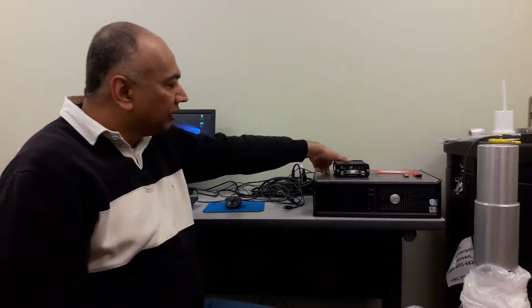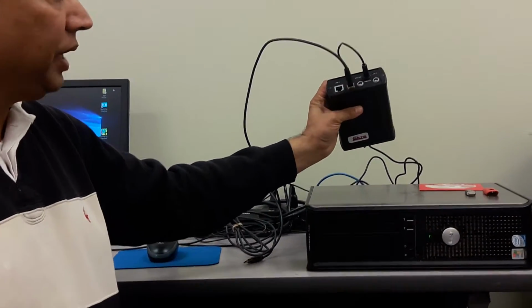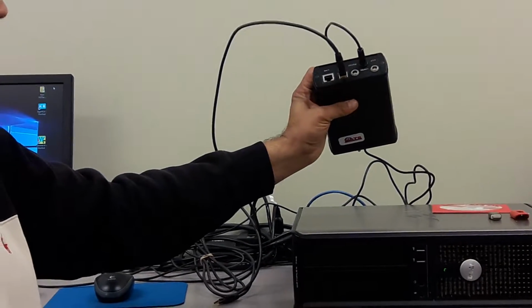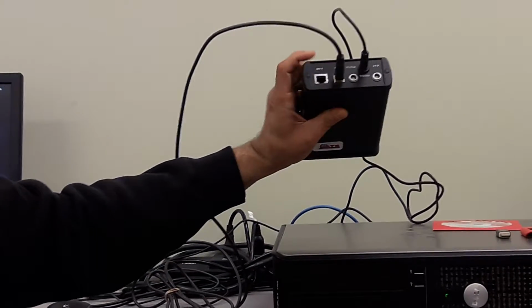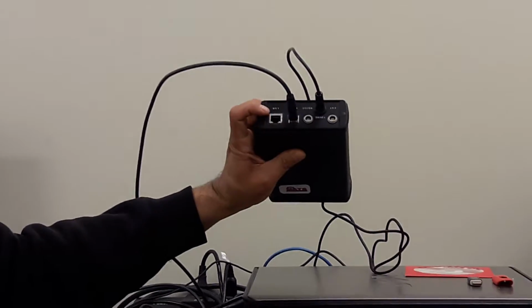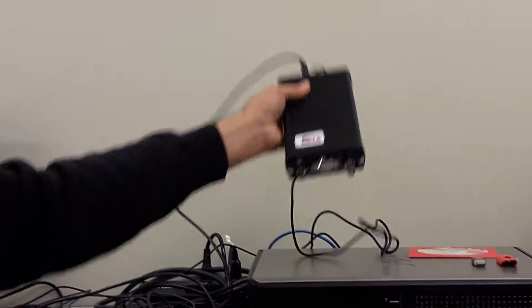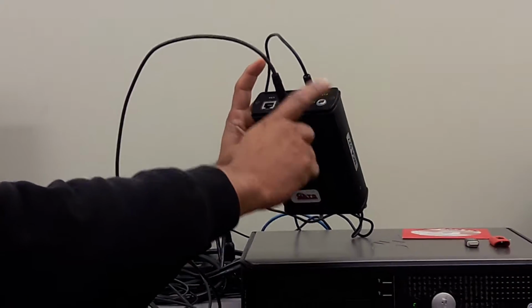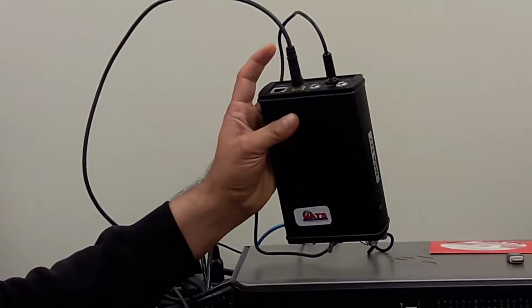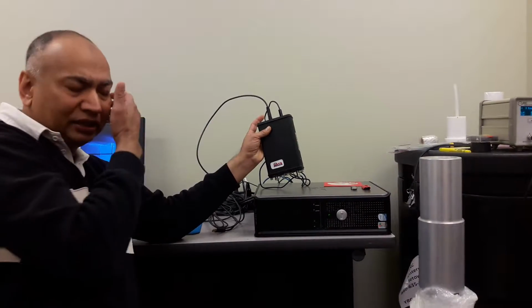It provides you the ability to connect this device to your computer either using a standard USB cable, a printer cable with a USB port in your computer, or it allows you to operate this directly connected to your computer using an Ethernet local area network cable. It is also a chargeable and portable unit, which means that you can use it in the lab, and if you lose power, there is also an internal battery which will let you run this MCA for 4 to 6 hours depending on the conditions of the battery in the system.